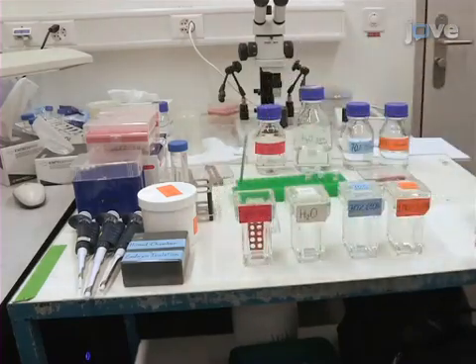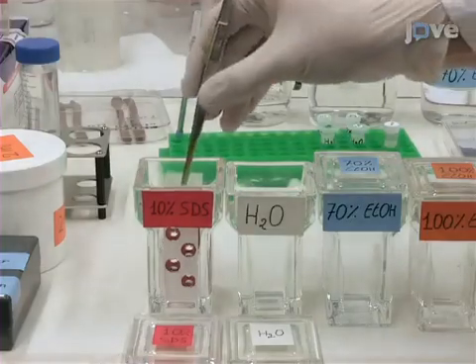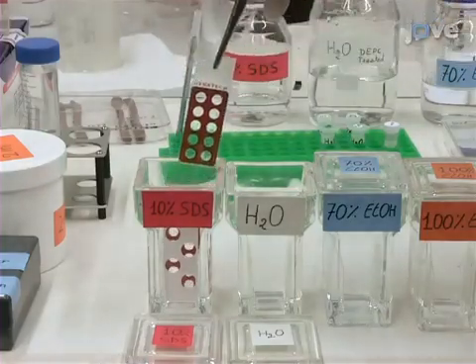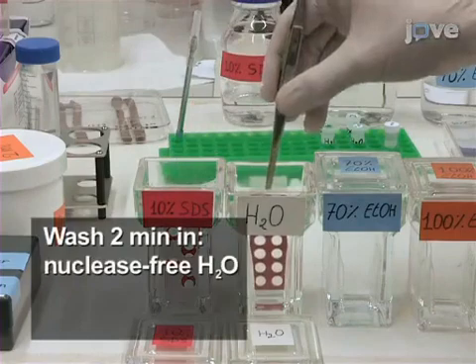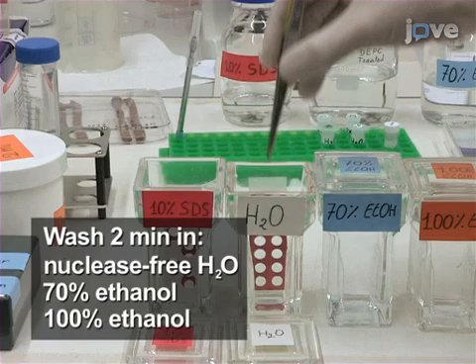Following detergent wash, wash the slides twice for two minutes in nuclease-free water, for two minutes in 70% ethanol, for two minutes in 100% ethanol, and then air dry.